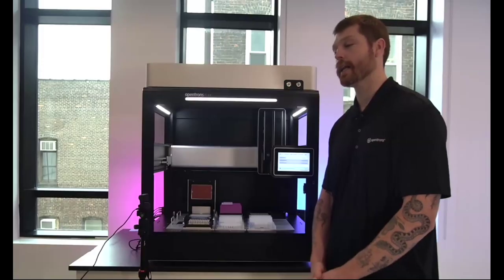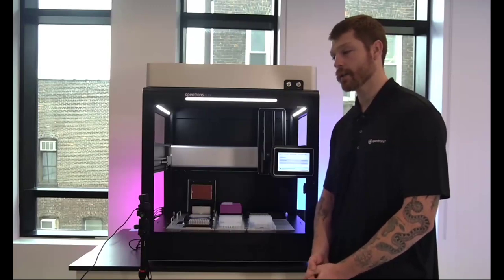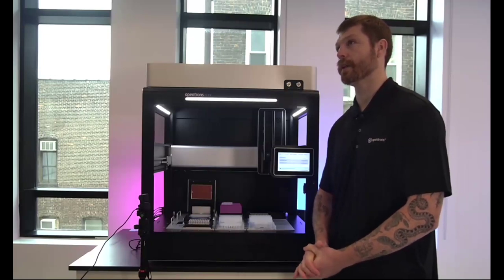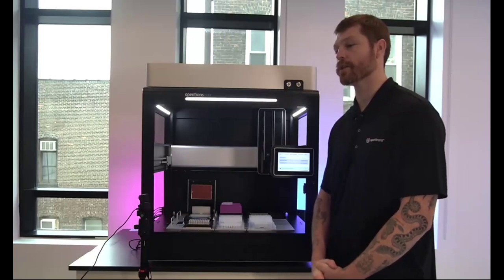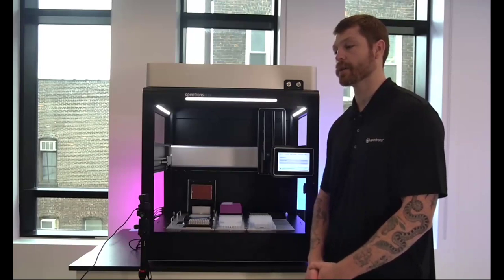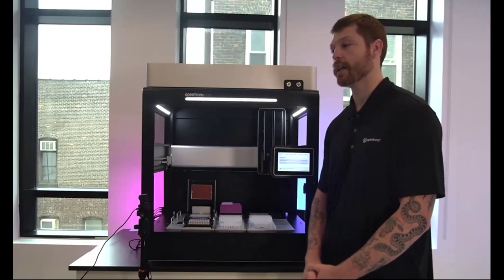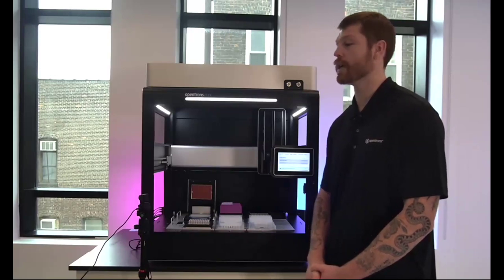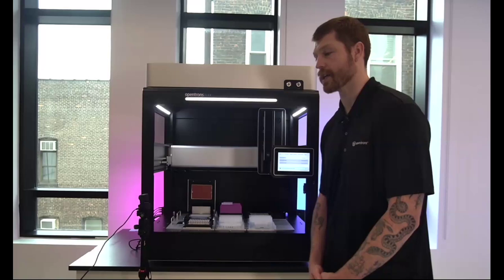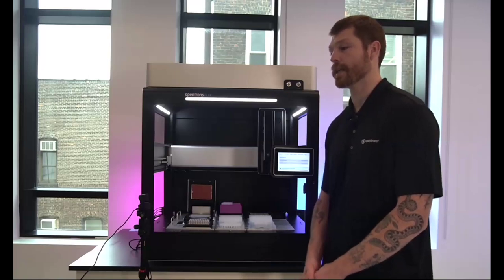Great. Next question. Is the quick transfer feature compatible with the waste chute? It is compatible. It will not utilize the waste chute though, currently, I believe. Actually, no, it may be compatible with the waste chute to dispose of your tips. So you would not be able to dispose of plates. In the quick transfer, we don't have the ability to use the gripper. It's really a transfer command. But you do have the ability to specify the drop-off location of your tips. That would not be an option here as I don't have a waste chute configured. But yes, that should be possible.